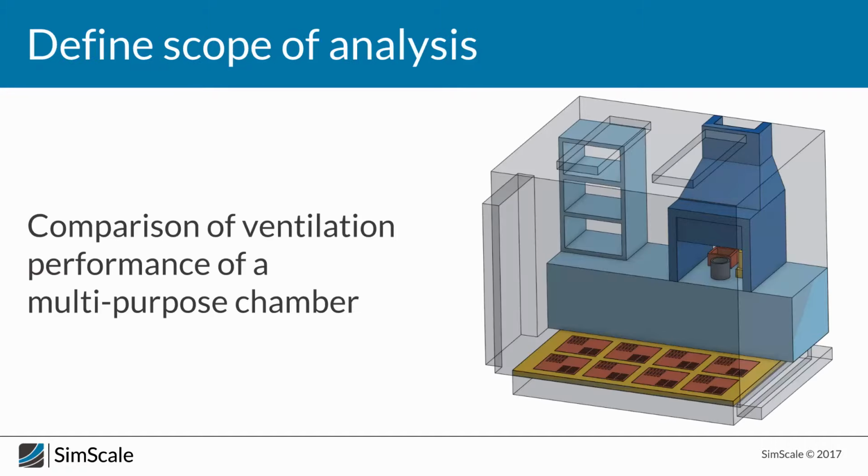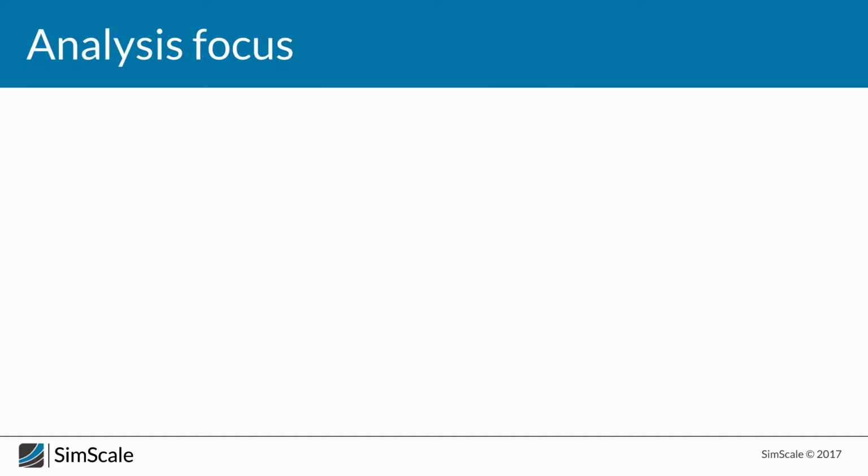Let's go back for a second. We see that there is a reaction chamber. There are some elements, some tubes, a pot, some kind of a box, and within them there will be reactions happening. Let's imagine that these pots will create gases that will be introduced into the system, and they could be some kind of toxic gases, which might be posing some kind of danger to the operator.